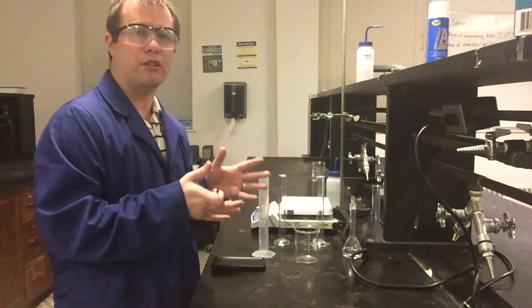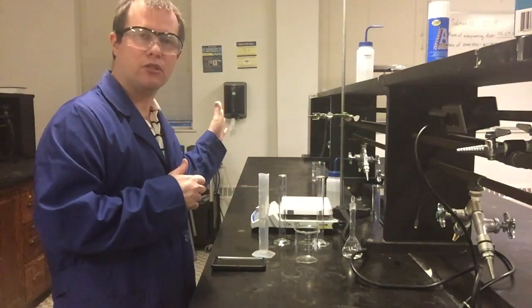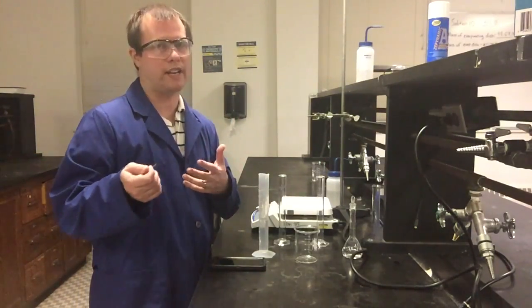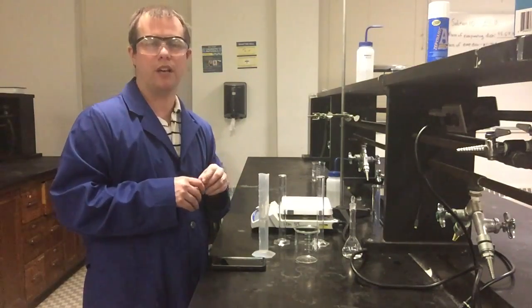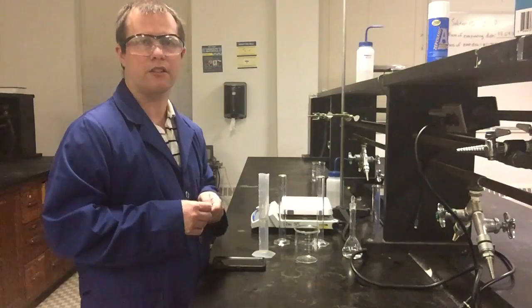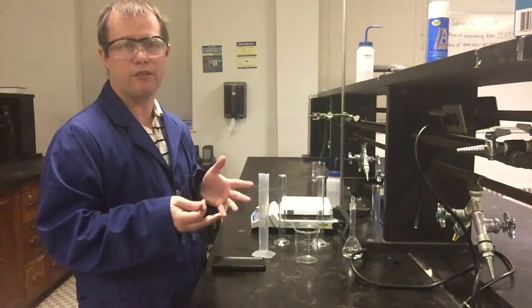But if you do have any of the leftover starting 6 molar HCl, you'd probably want to take a little more precaution. We try not to add it back into the original container, just to avoid contamination usually. But you'd probably want to neutralize some first before you would actually put that down the sink. Like the 1 molar solutions, if you have just a little bit of them and there's enough water, you can usually pretty safely put them down the sink if you just dilute them with water and run the water in the faucet as you get rid of them. But 6 molar is probably pushing it a little bit, so we want to probably neutralize that before we get rid of it if we did have any excess.